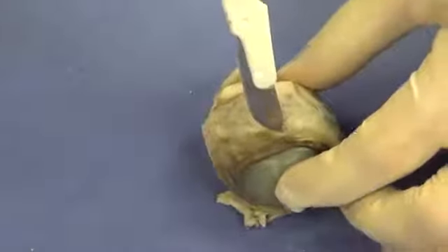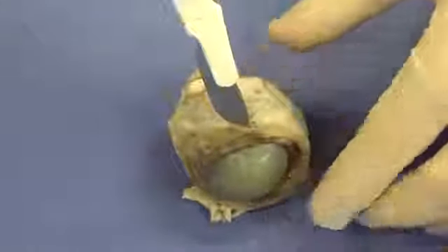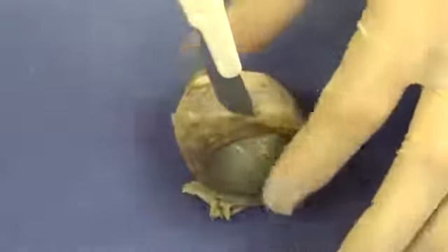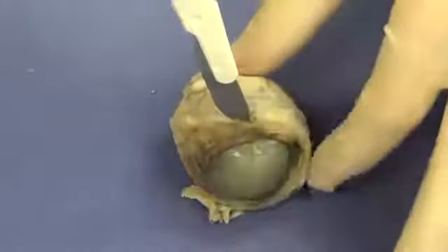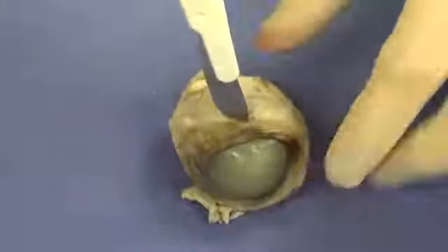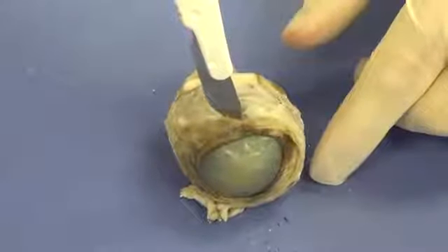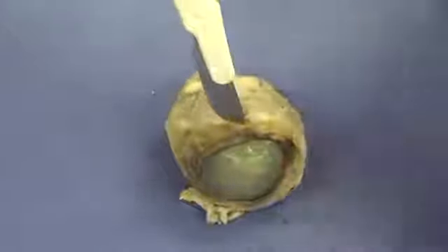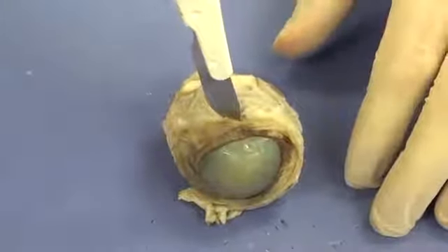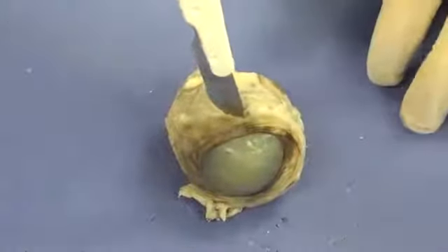And I'm going to gently push straight down. You can see that there's liquid inside the eye. And this liquid and jelly substance inside the eye helps maintain the shape of the cornea and the inner shape of the eye. We'll take a look at that. When I cut through here, you're going to see some liquid actually come out. And that liquid is called aqueous humor. One of the things that liquid does is help maintain the shape of the eye. We certainly don't want wrinkles in the eye as light is passing through it.